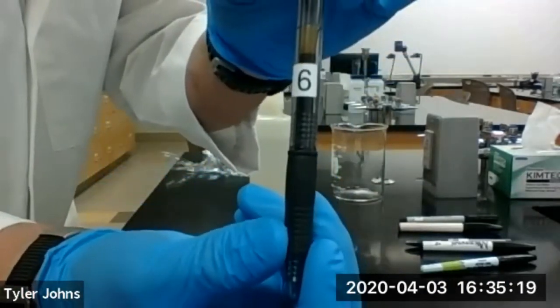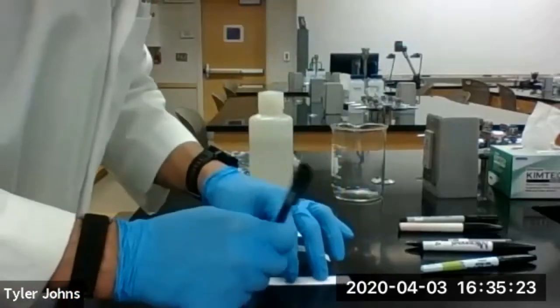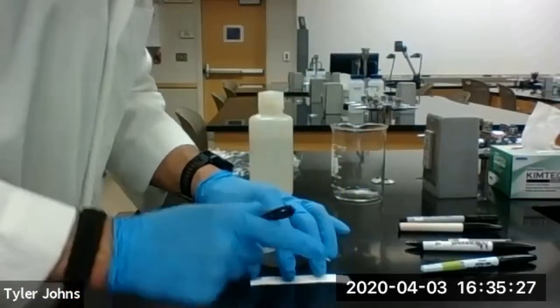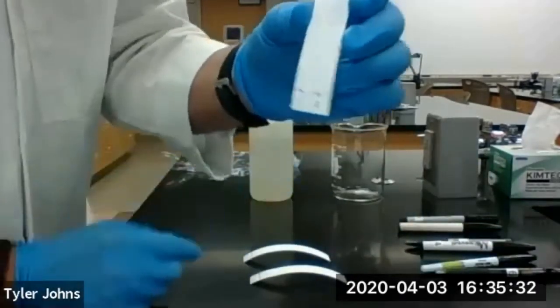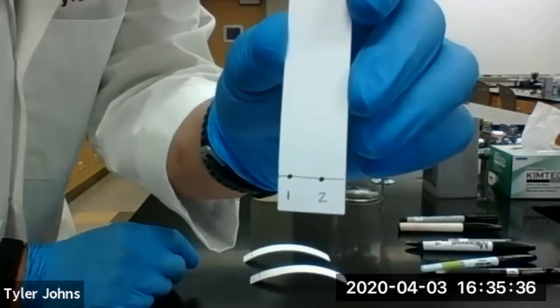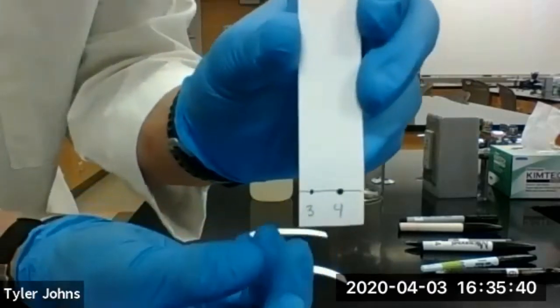Suspect six's pen — this is the pen I use, I hope it's not this one. We've spotted our pens at the bottom of each chromatography paper. This is how they look right now.